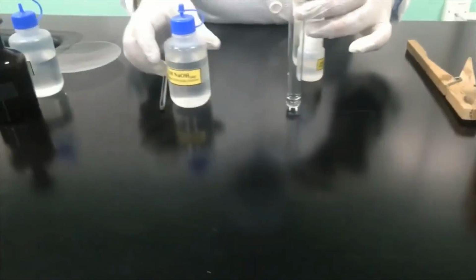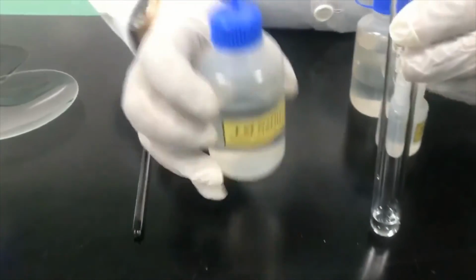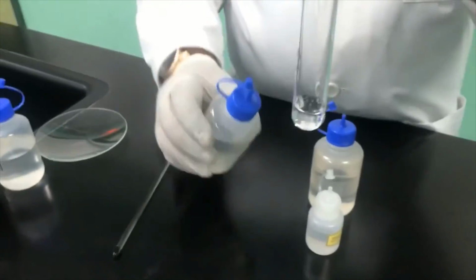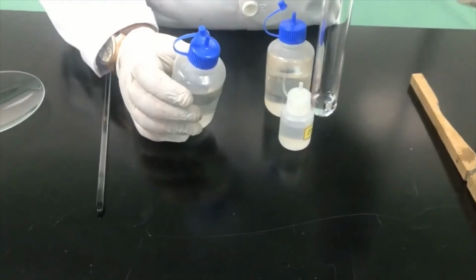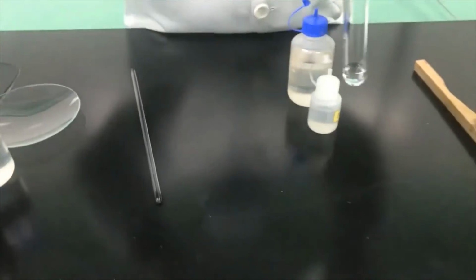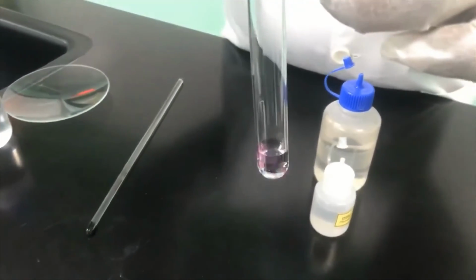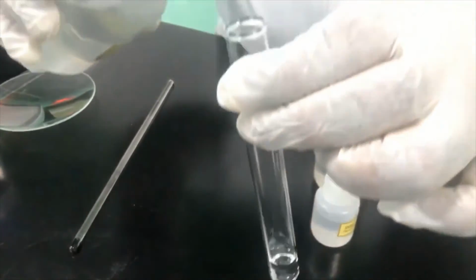Okay, now we will continue with the addition of the base, sodium hydroxide. Now I will add the sodium hydroxide dropwise. You can see here, I just add 1 or 2 drops and the solution is still colorless, which means the sodium hydroxide is reacting with the acid in the test tube and still extra acid molecules are present. So there will be a point when enough sodium hydroxide is added that it will completely react with the acid. You can see that some pink color appears, but when you shake it, it goes.